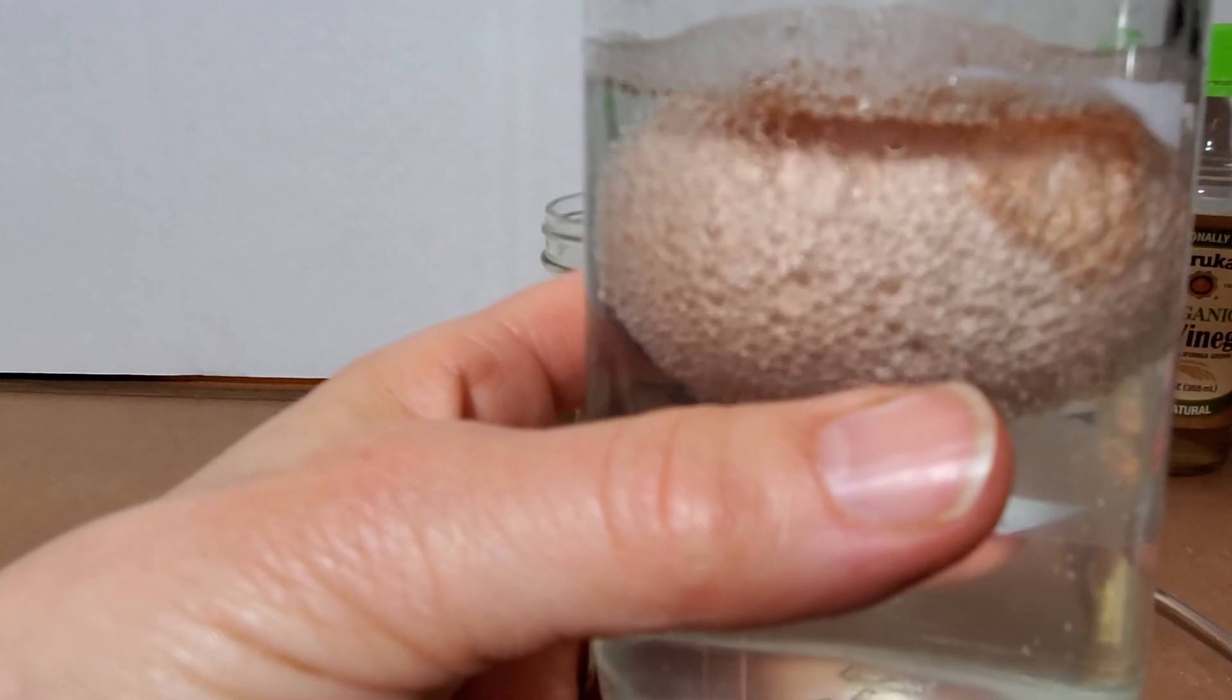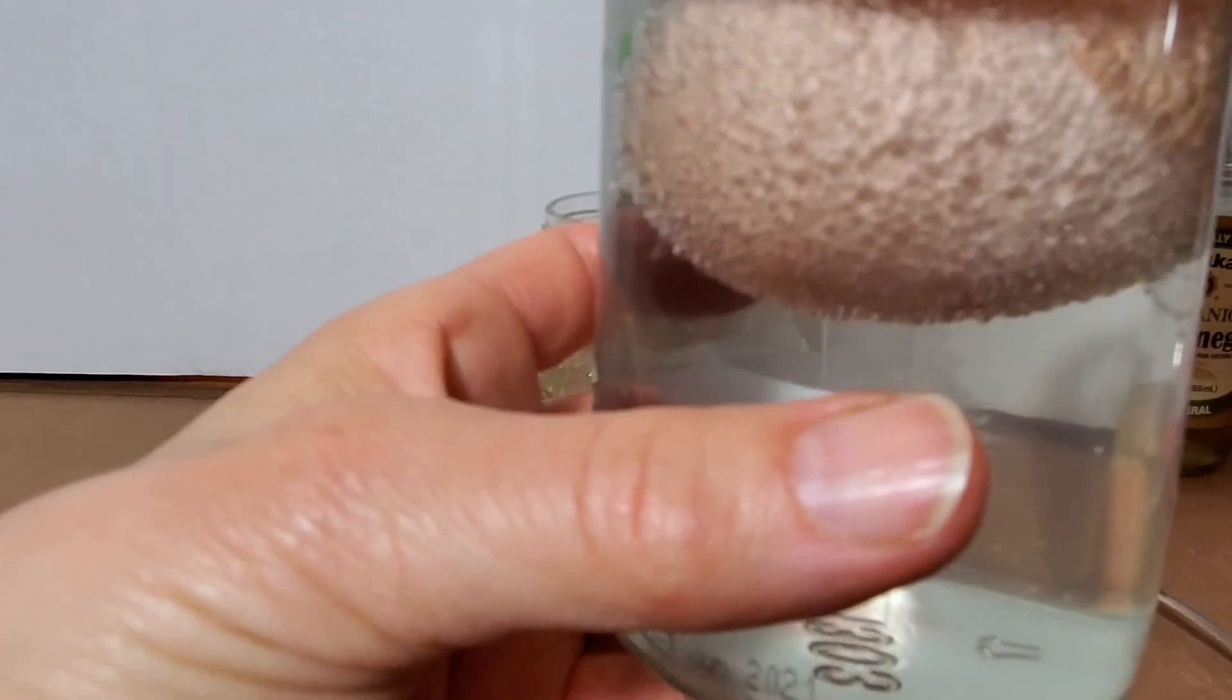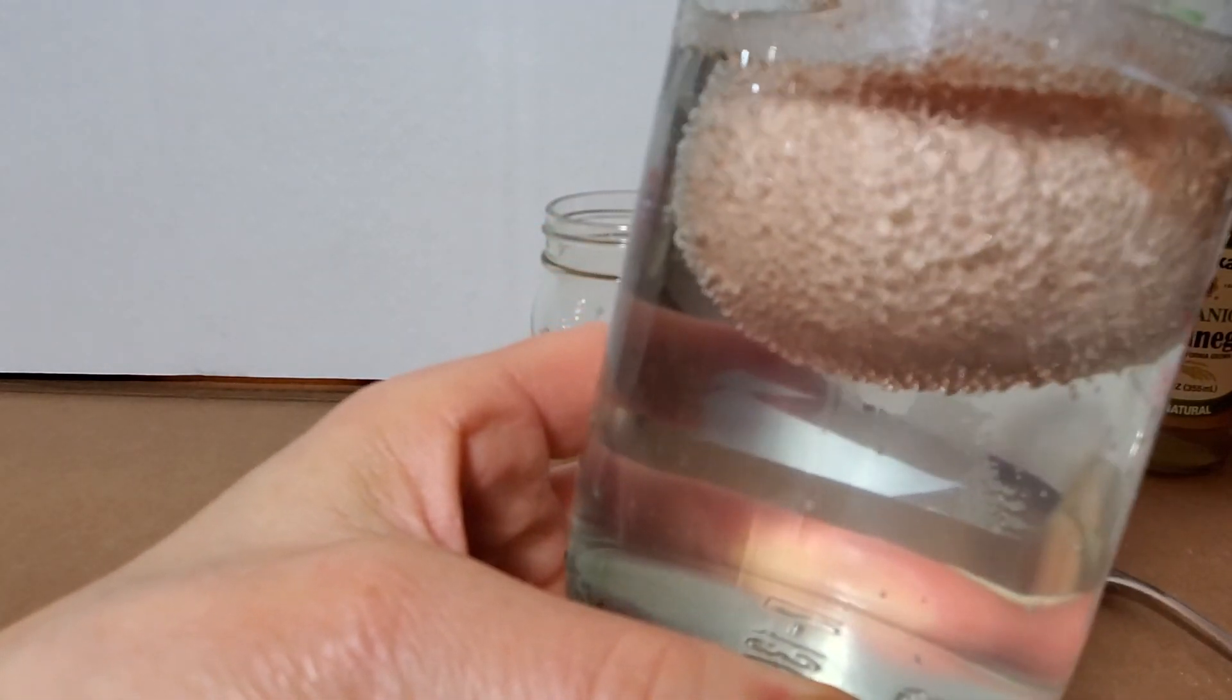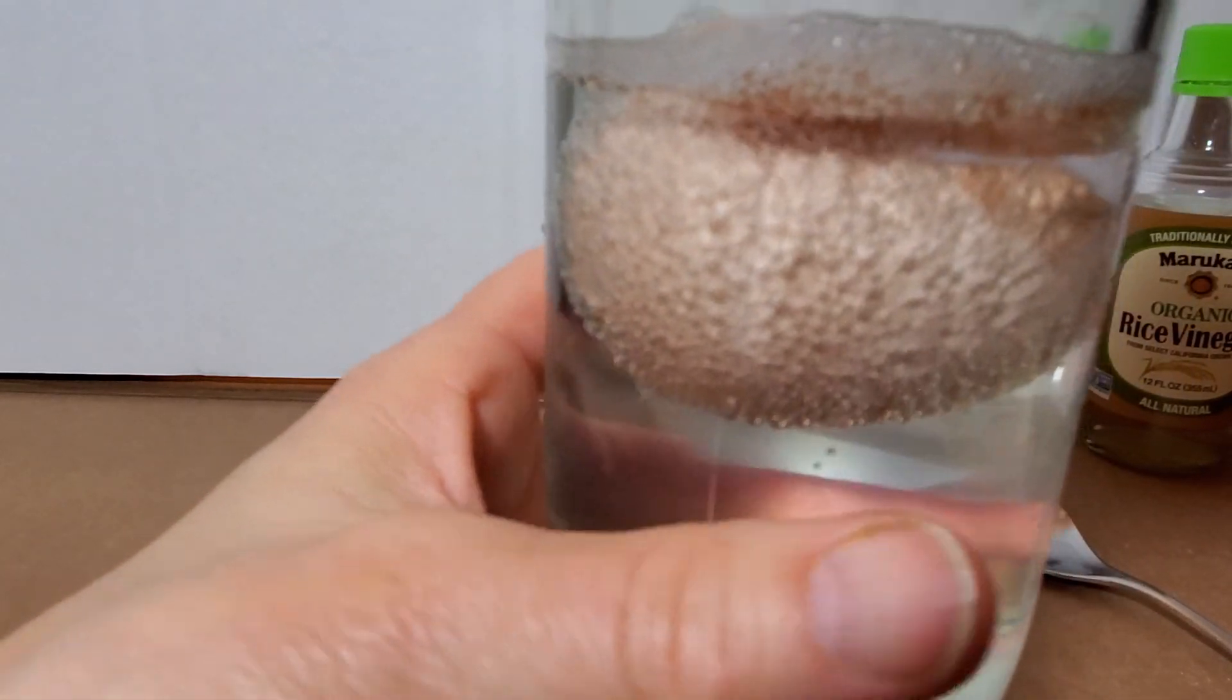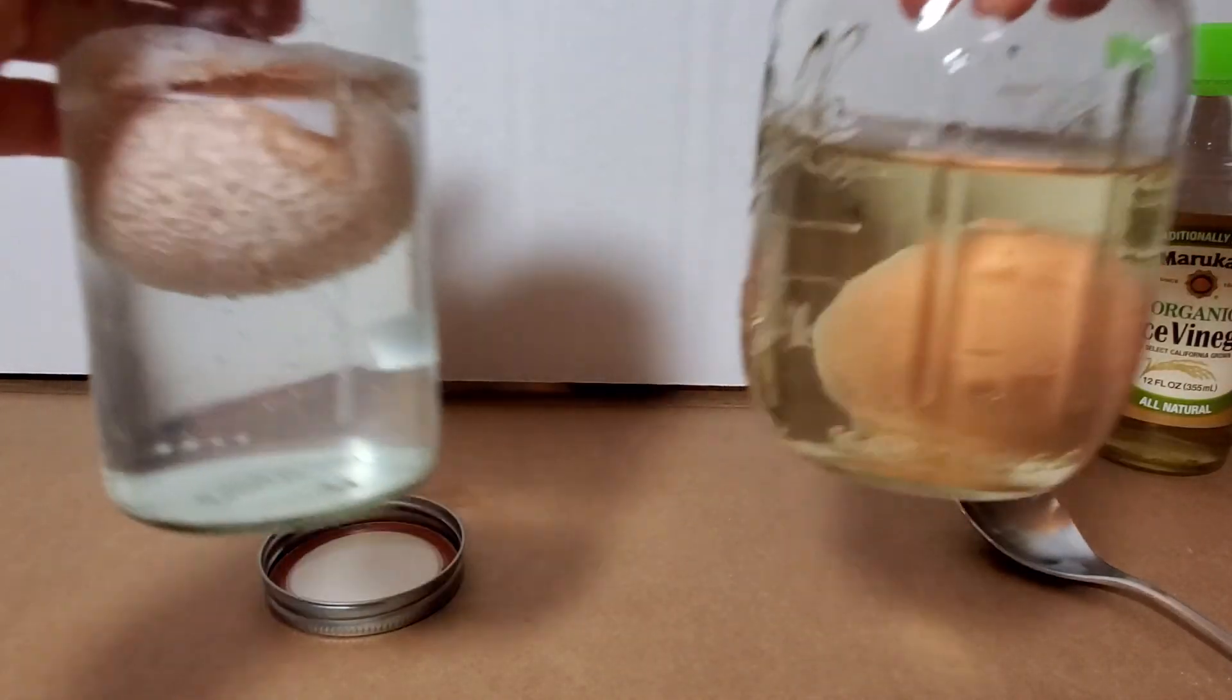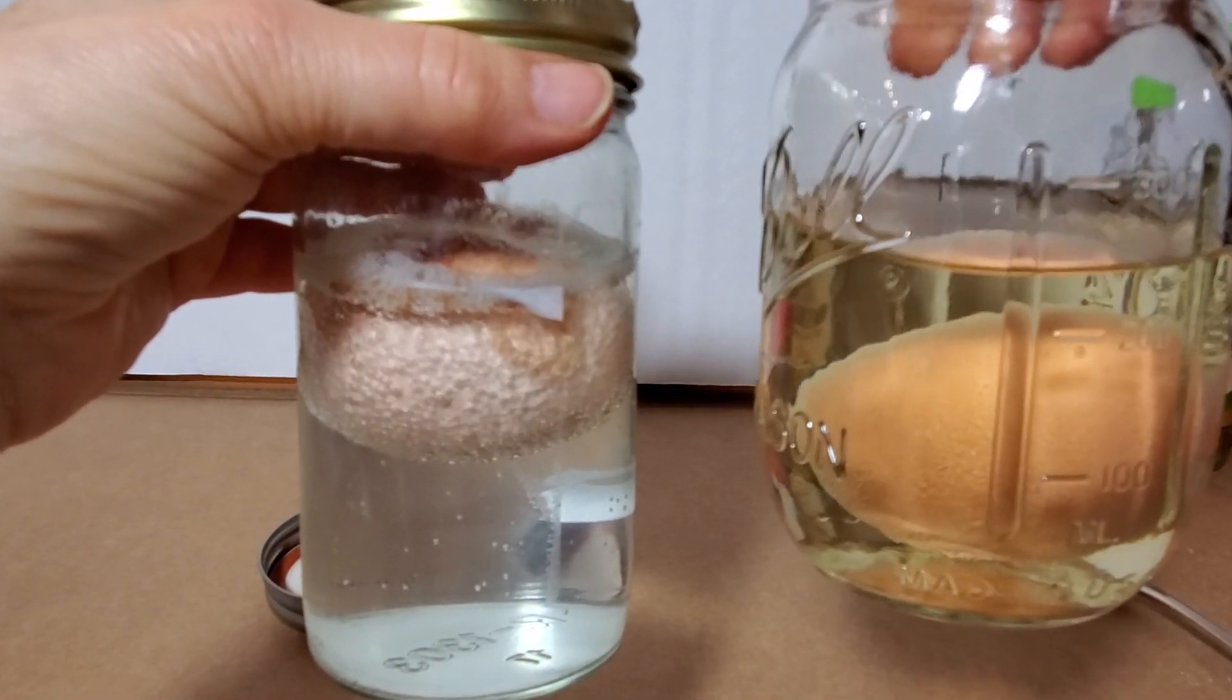So it's a really kind of cool lab. It's going to feel like a bouncy ball. It is not a bouncy ball. It will, if you drop it, just break and splatter open and you'll have raw egg everywhere. So you want to do this in the sink. Also notice how much it is swelling. I don't know if you can see the size difference as it's soaking.